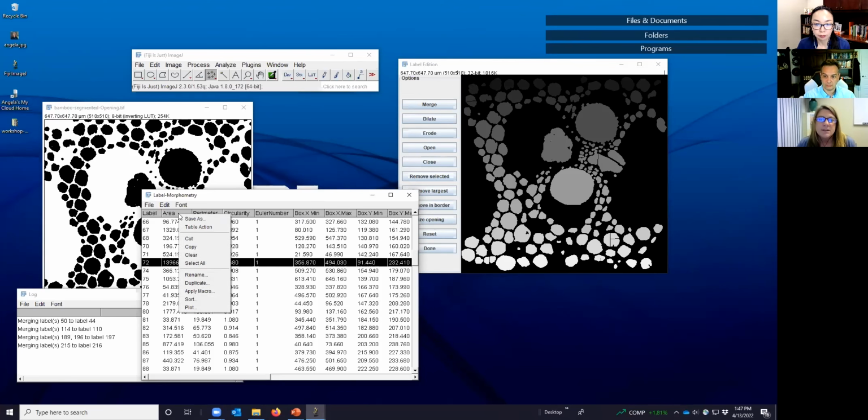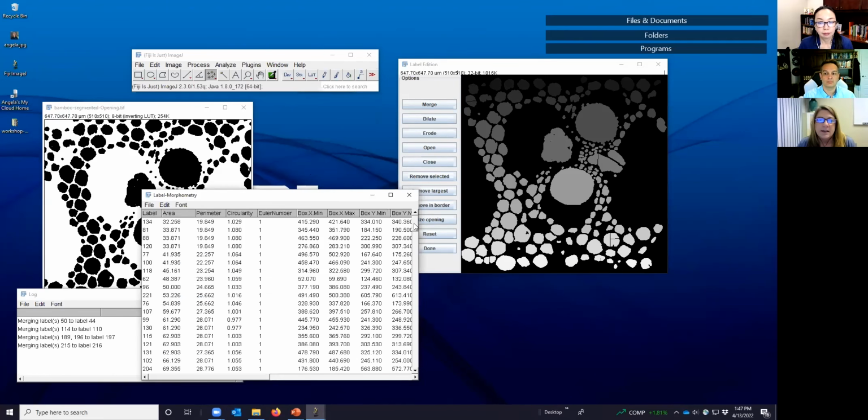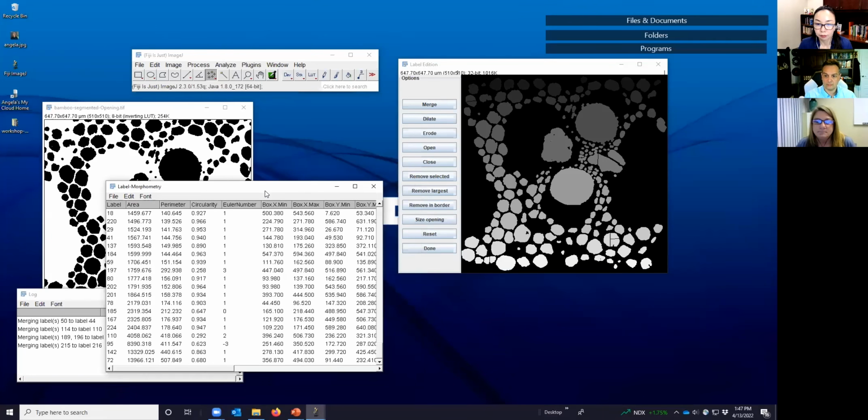You can do that. If you right click and click sort, then you can choose which particular parameter you want to sort by. If we just click area, okay, then we see that the smallest one is at the top and the largest one is at the bottom. And it turns out that's 72 that we just looked at. The MorphoLibJ plugin is always going to sort these from smallest to largest. There's no way to do it in the opposite way that I know of anyway. If you know how, let me know.